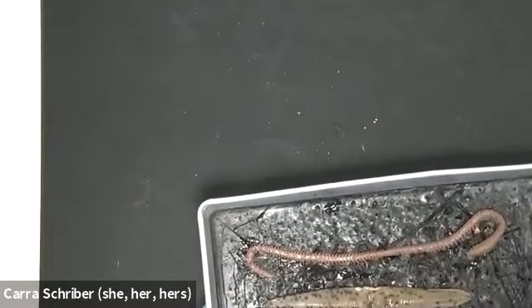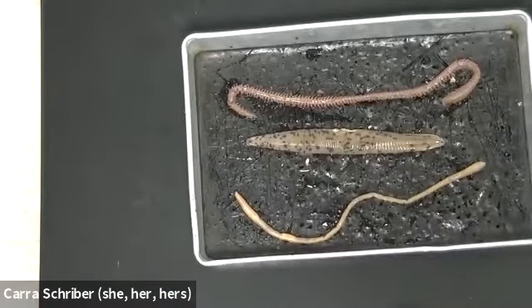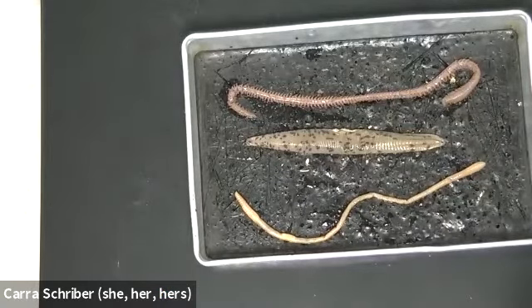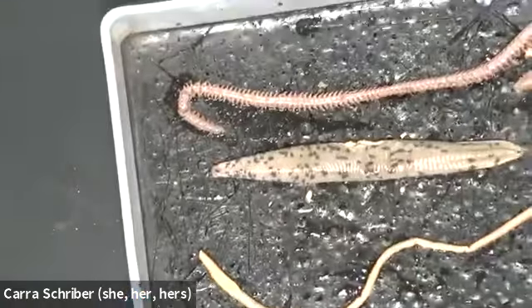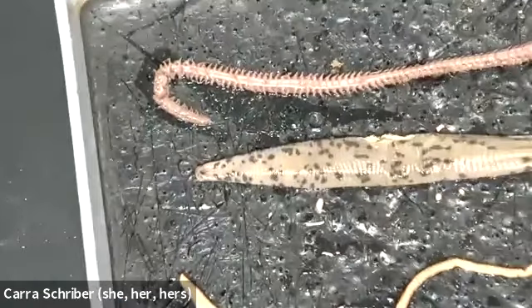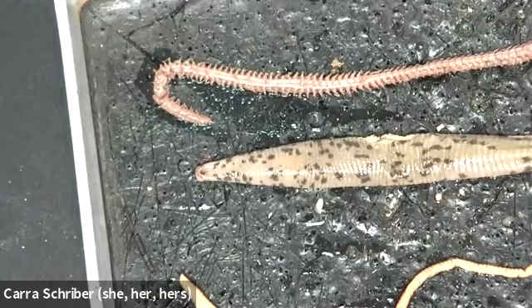All right, so now we're going to move on to our segmented worms. My apologies, I said flatworms. I pulled out 3 different samples of segmented worms. So just wanted to zoom in here. Worms aren't everybody's favorite, so it's no big deal if this kind of grosses you out. But we have 3 different specimens here, and all of them are different versions of a segmented worm.